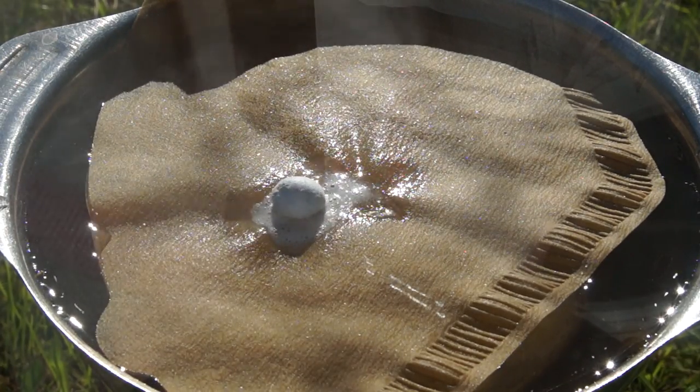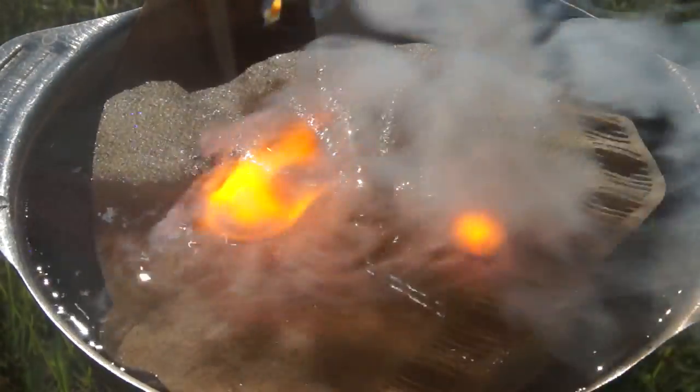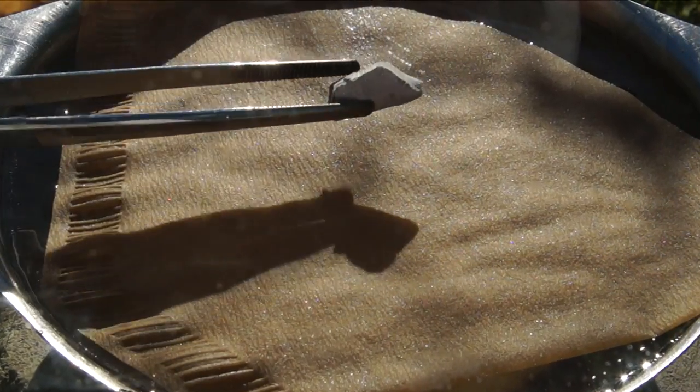As a result of the heat during the reaction, sodium eventually melts and then ignites. But after this, an unusual effect takes place which I still cannot explain — burning stops, and a droplet of sodium that was just black becomes red and then transparent. After that, the droplet begins to float on the water surface, and in the end it explodes.